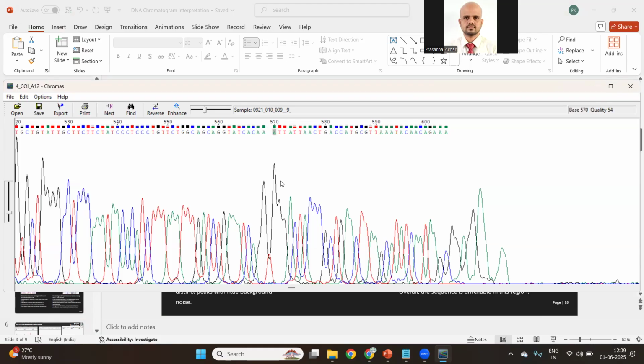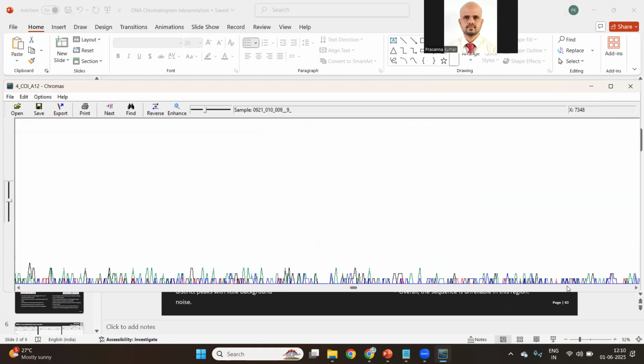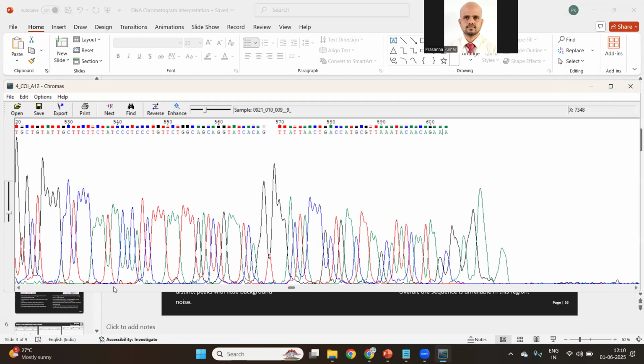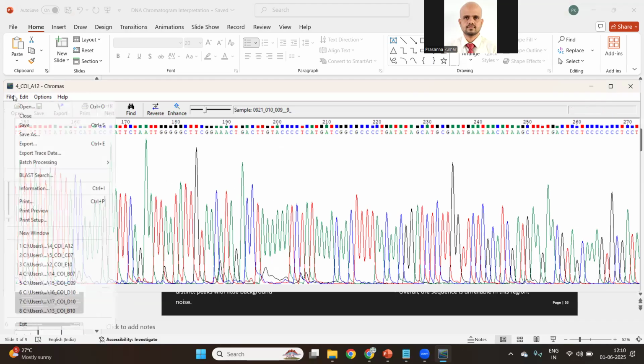If you say, for example, this is G instead of A, and you want to change it to G, just select it and press G, or in caps, press G. You can edit the chromatogram like this. You can change it here. Finally, after editing the chromatogram from the beginning to the end region, see, this is more noisy, so I just deleted all the noisy region.